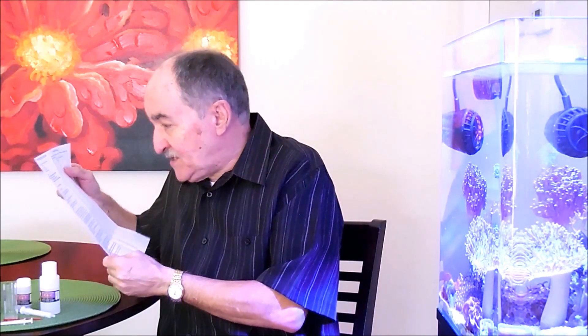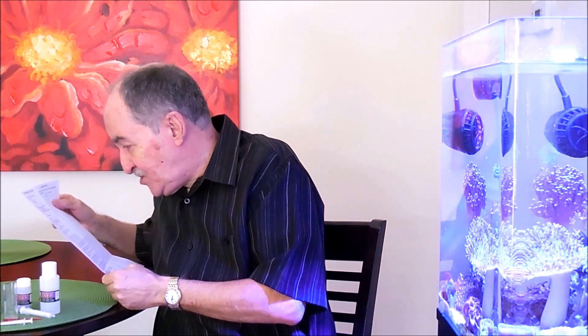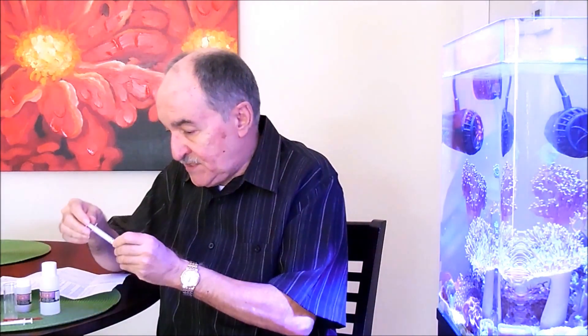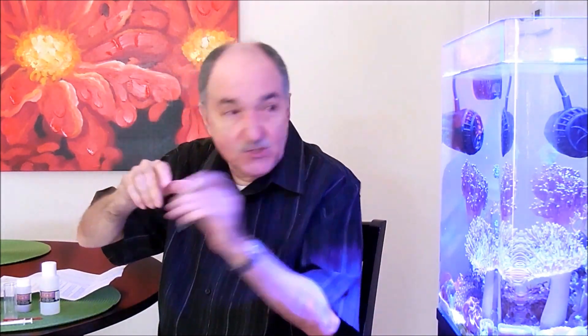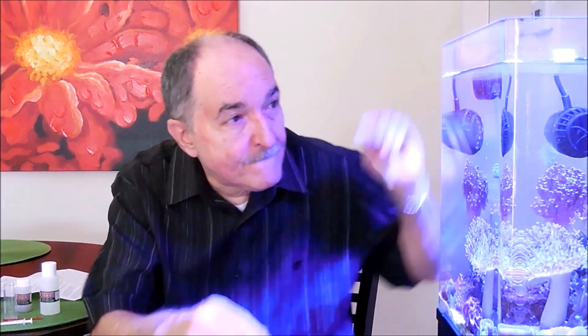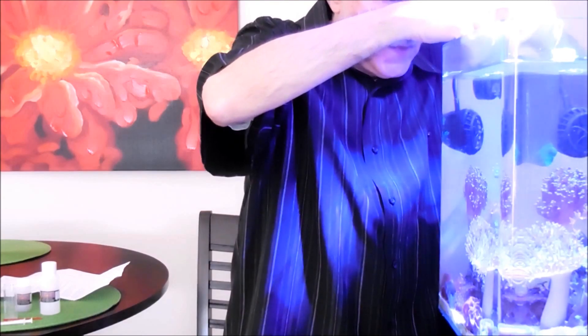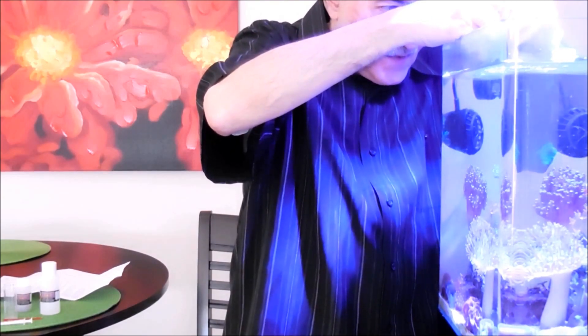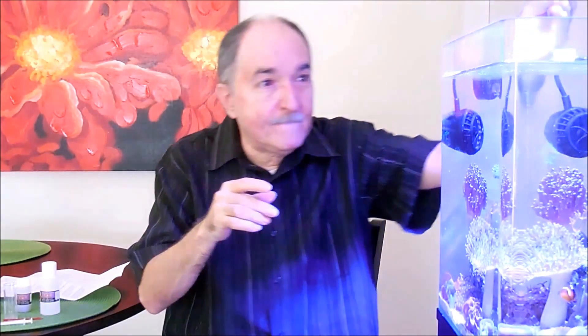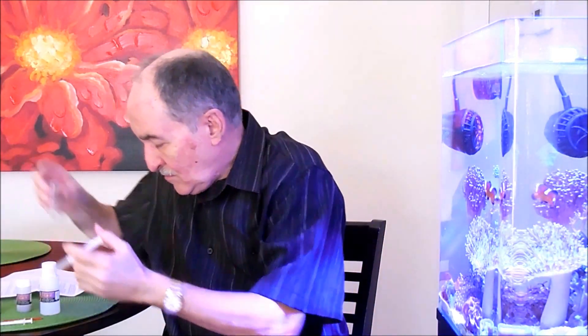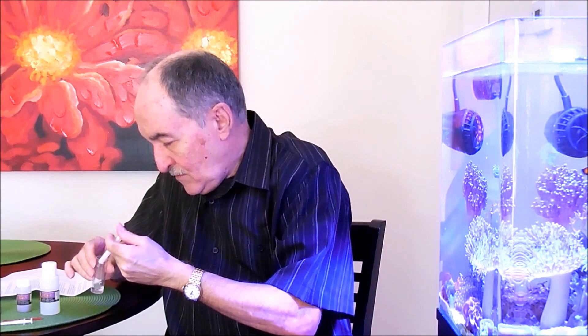The first thing it says is add with a syringe 2ml of water in the test vial. So this is the 2ml, let's go ahead and add some water. Perfect.